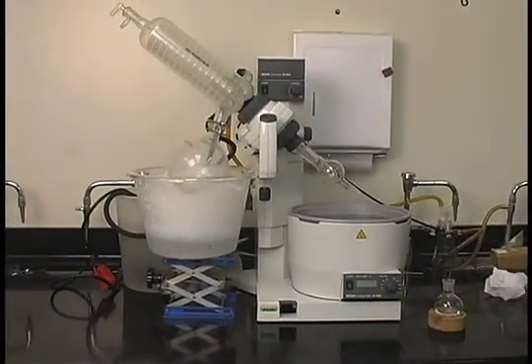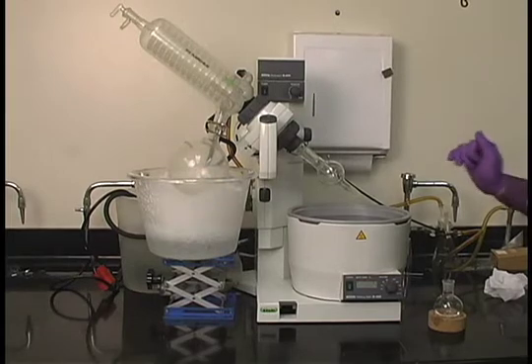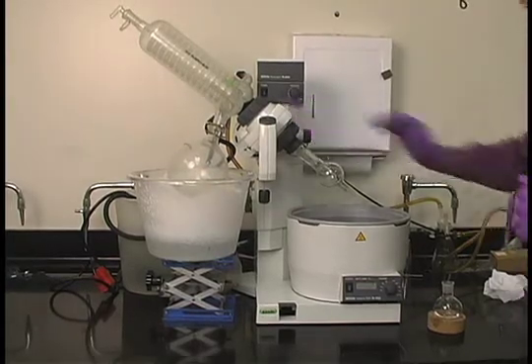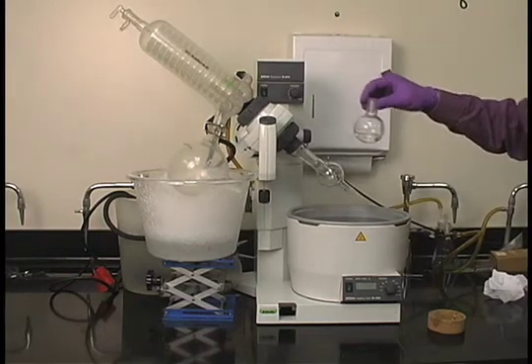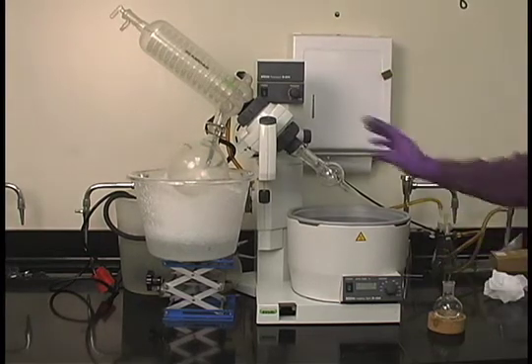Evaporation using a rotary evaporator. When using a rotary evaporator, we will be removing the liquid from our solid solute using this evaporator under low pressure.